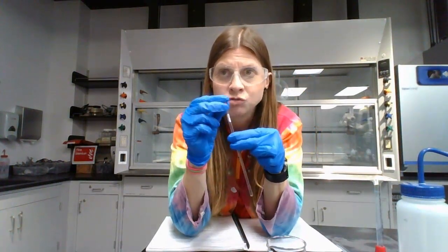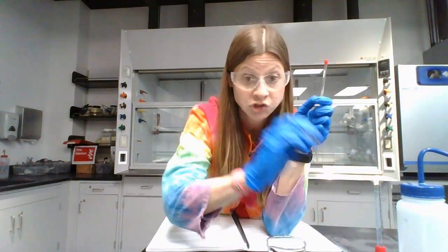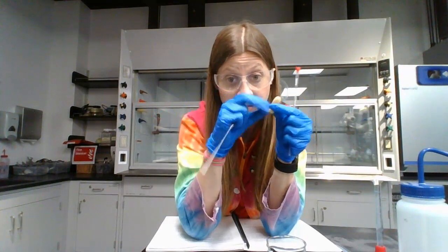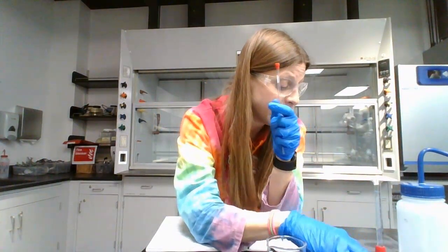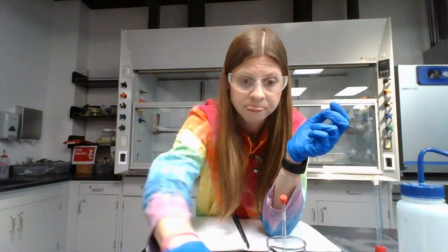These NMR tubes can be reused, but if you use too much of your strength, you will crack them, so be gentle. Just repeat this with a new Pasteur pipette for each solution, and you can use the same bulb. The bulb can be reused, okay? But the Pasteur pipette is one use only, one chemical only. Put it in the broken glass box and repeat this until you have either 2 or 3 NMR tubes filled with standard. That takes care of part A.